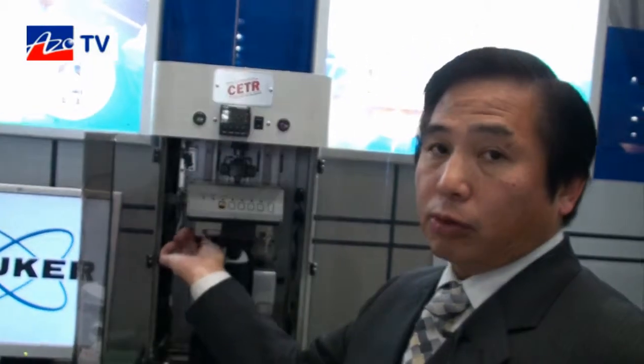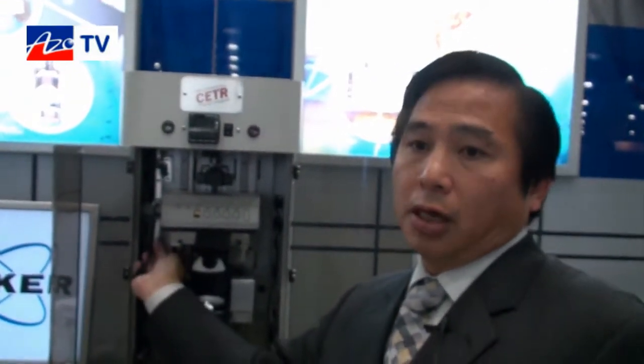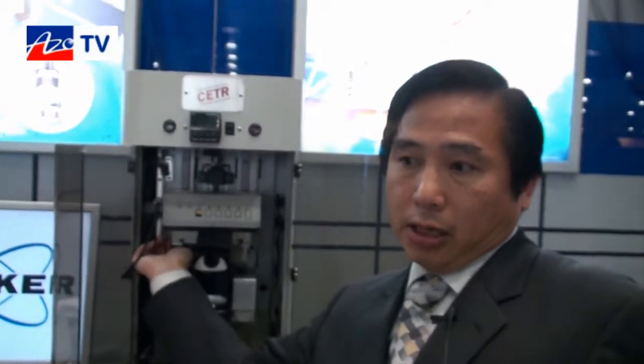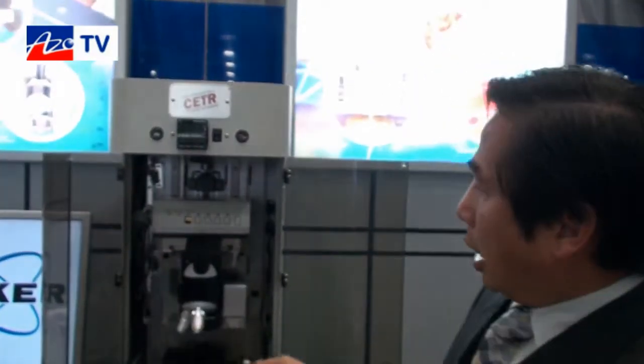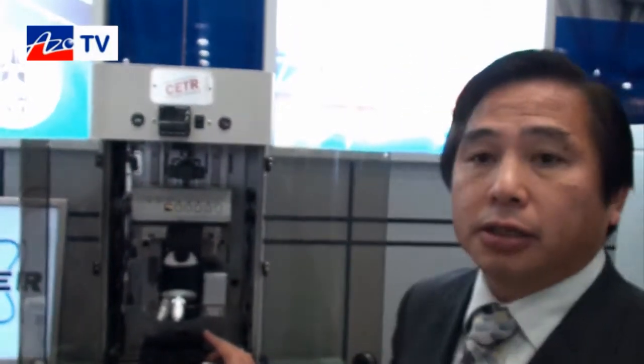The micro head we have has a capability of up to 20 newtons. For the nano head, the load resolution is 0.03 micronewtons, and for the micro head the resolution is up to five micronewtons.